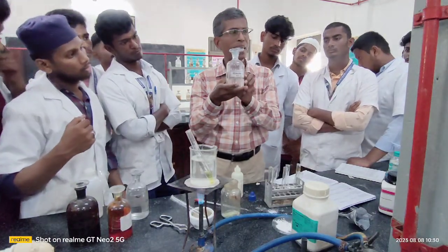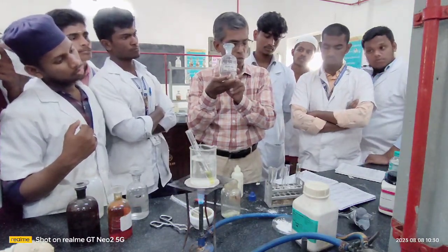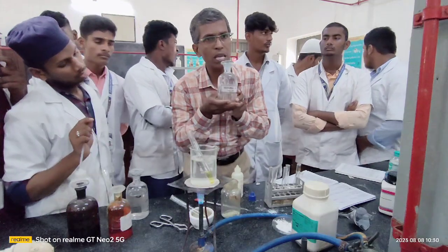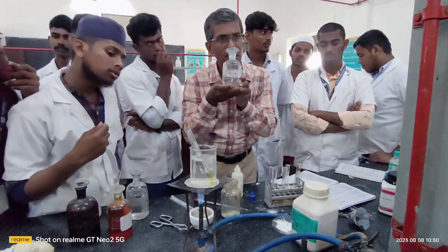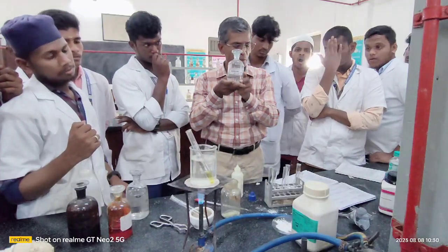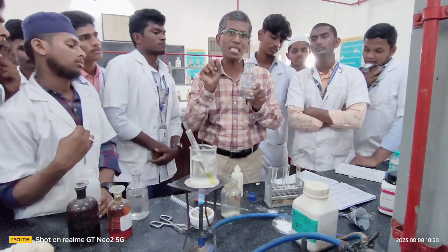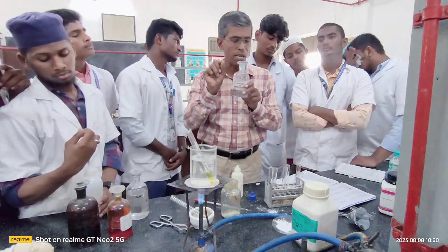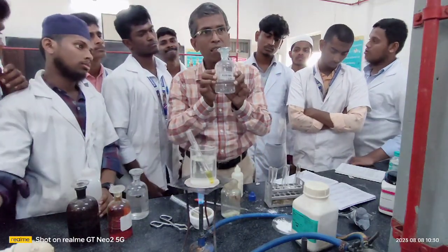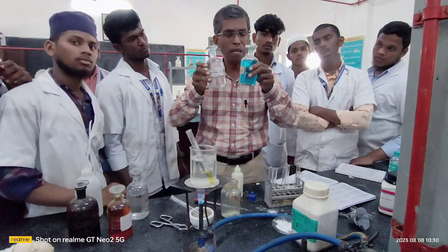Fehling's solution B is normally colorless. What is Fehling's solution B? Fehling's solution B is nothing but potassium sodium tartrate, and mixed with sodium hydroxide. This mixture is called Rochelle salt. The mixture is otherwise called Rochelle salt. Its spelling is R-O-C-H-E-L-L-E, Rochelle salt. Rochelle salt is nothing but potassium sodium tartrate in sodium hydroxide. This mixture together is called Fehling's solution B. So keep Fehling's solution A ready and Fehling's solution B ready.